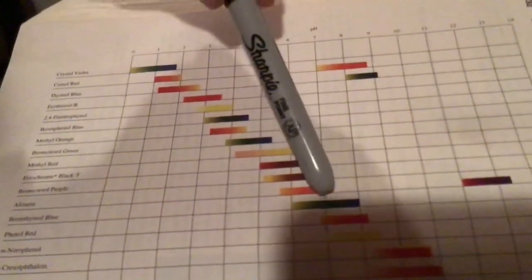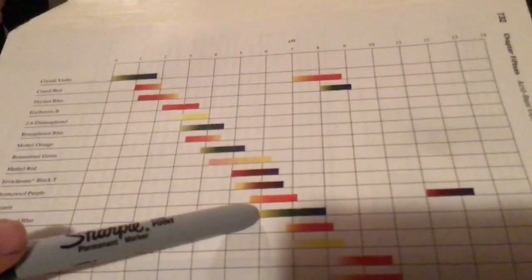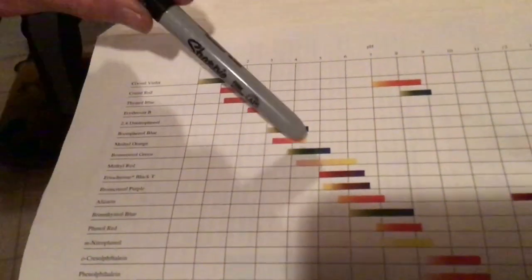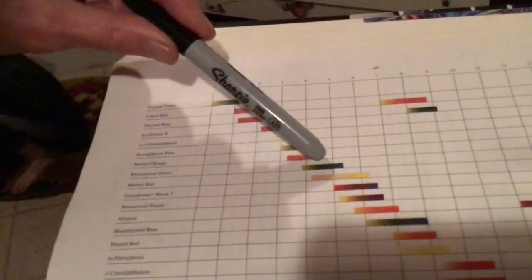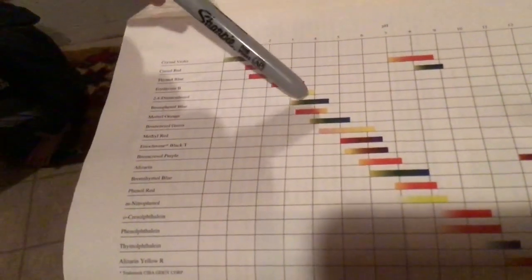We have bromothymol blue, and that one changes at about a pH of 7. Notice it started blue and went to a greenish yellow at a pH of 5 to 6. It even gets more yellow if you can get more acid in there, but breathing won't give you that. Bromocresol green really changes at a little under 5, so it's a good thing it did not change colors when I'm breathing out. And the methyl orange changes at about a pH of 4. Again, that would turn more red if I add an acid.